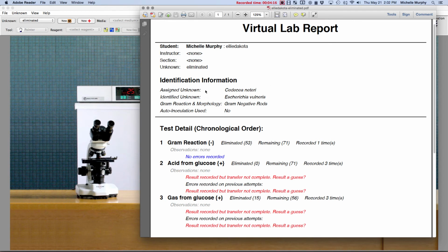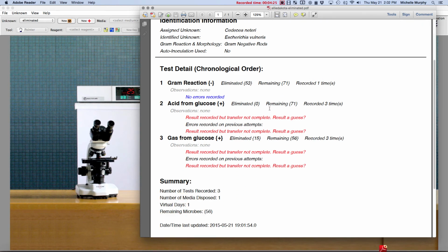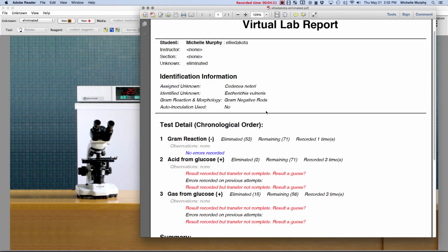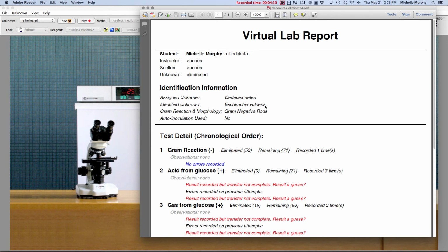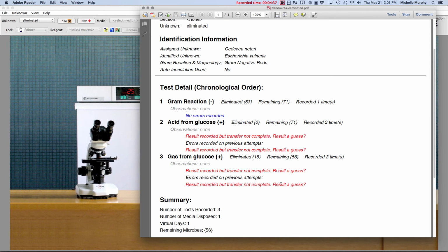All right, now on my lab report, this was the unknown I was assigned. This is the unknown that I said it was, which was wrong. And the good thing about the lab report is that it tells me everything I did wrong. So when you turn in your lab report, you always have to turn in your PDF so I can make sure you did it during this semester because it gives me a date, and it will track every single thing you do wrong, which is a good thing because that's how you learn.